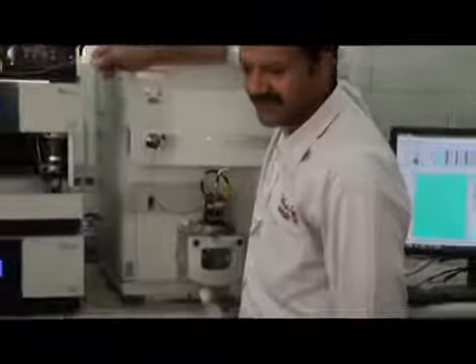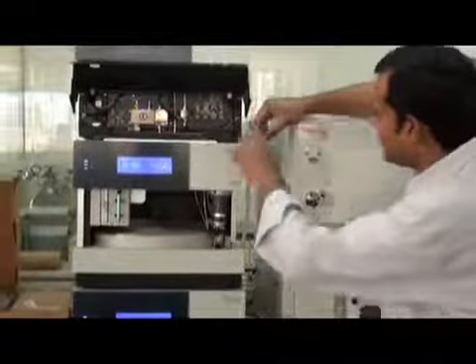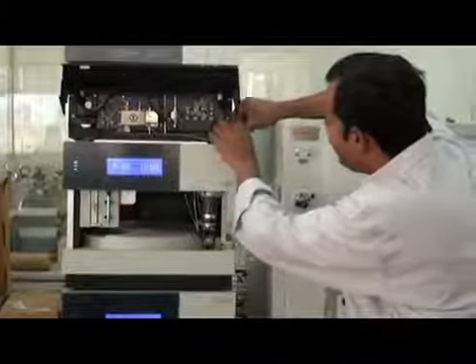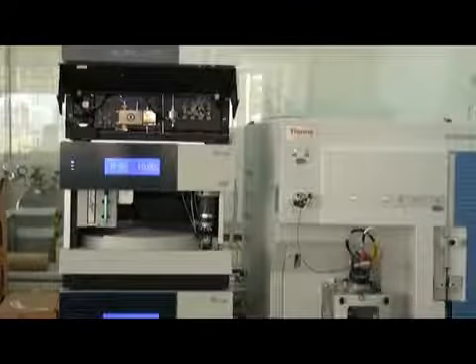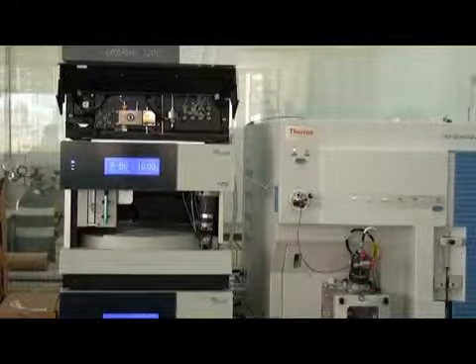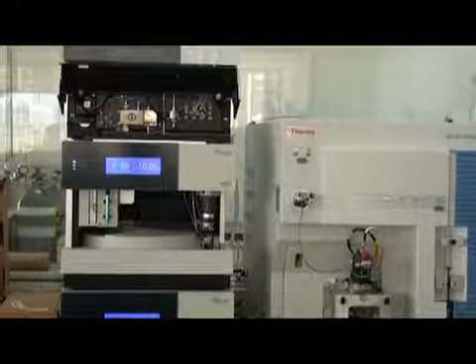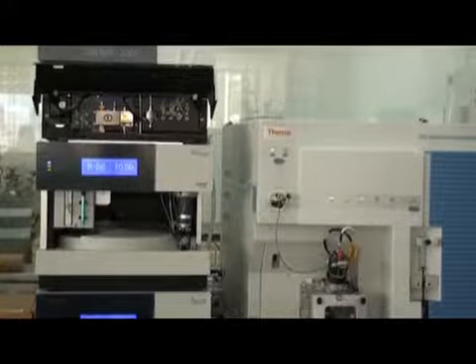Okay. The liquid should be coming from here. Okay. If you want to see, I can show it to you. This is the liquid coming from line A. Okay. So this will be done for 5 minutes. After 5 minutes, it will automatically stop. Okay. Then you will do the purging of line B. Okay. And line D. Line C no need.